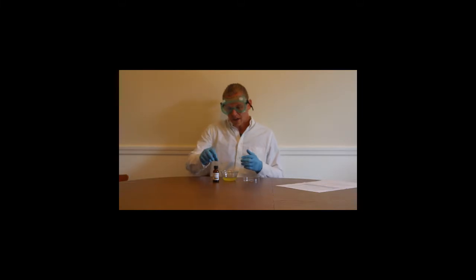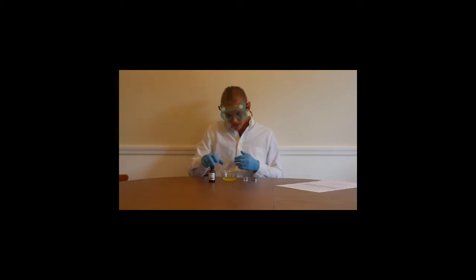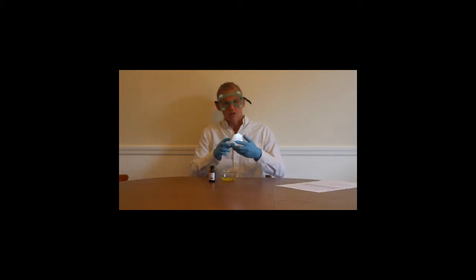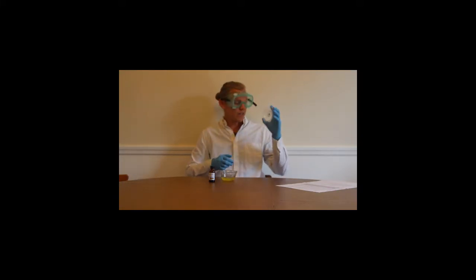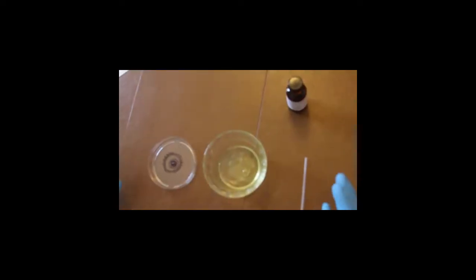So you see here I have a bottle of sulfuric acid. This is that very strong corrosive acid. And I would have gotten this out of the chemical storeroom, and I would immediately return it to the chemical storeroom as soon as the experiment is over. I also have a pipette. I have some egg whites. I've separated the yolk for the purpose of the demonstration. And then I also have a petri dish here, and I've drawn an eye, and it's supposed to resemble a human eye. So here we are.